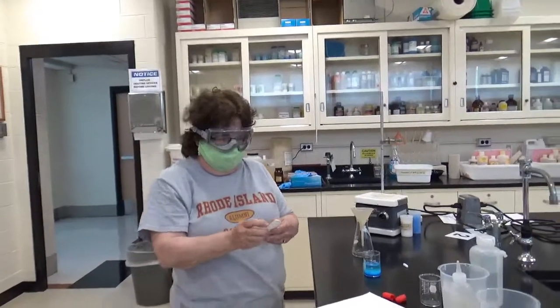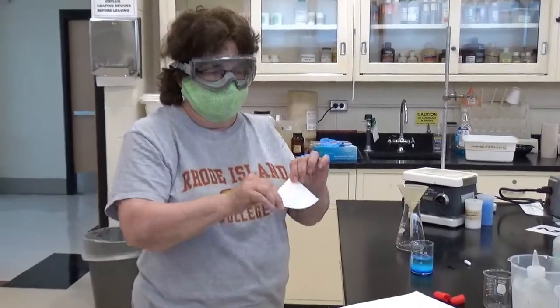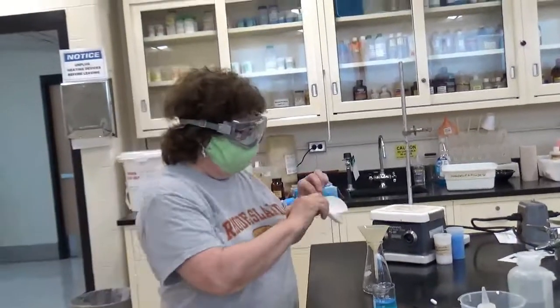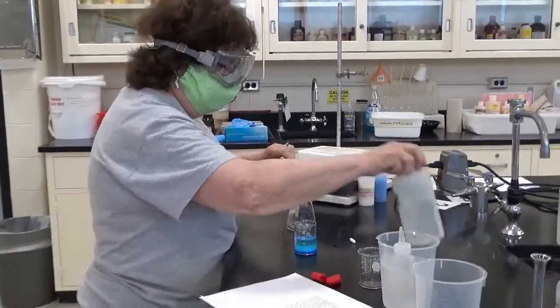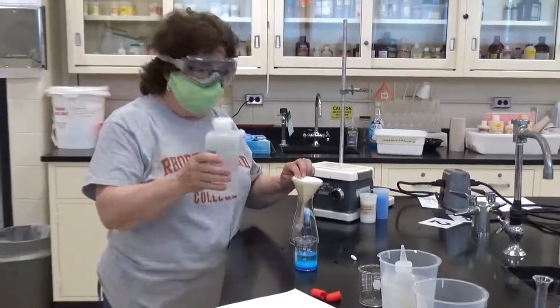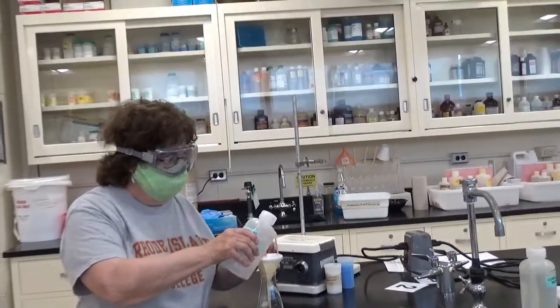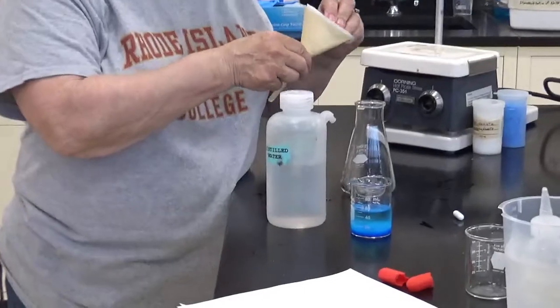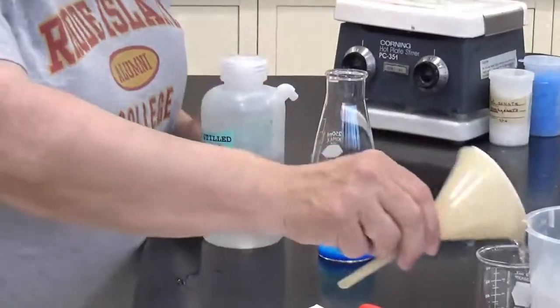So I take my filter paper. I fold it once. I fold it twice. Then I open it, so I have a little cup. I'm going to use a little distilled water. Distilled water isn't going to damage anything here. And we're going to wet it so it sticks to the sides. I'll discard this extra.